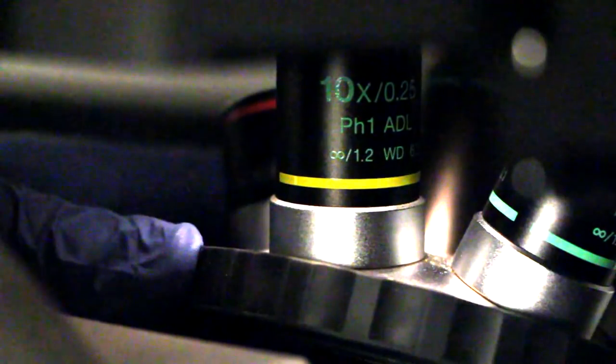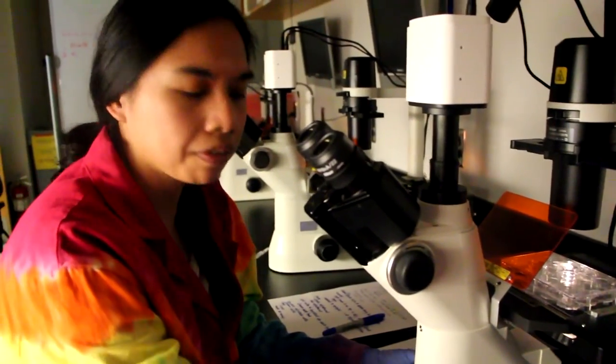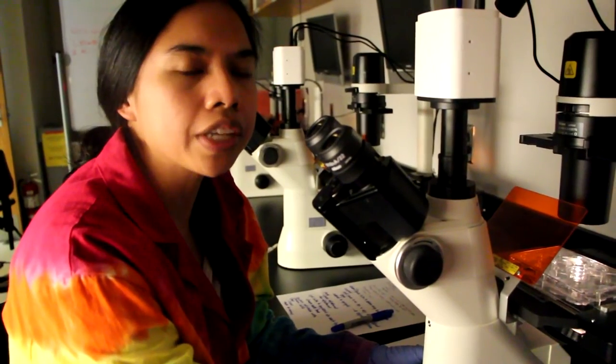Once you've been able to focus on your cells at 4x, you can change to a higher magnification by changing the objective. Then use the fine adjustment to bring the cells into focus.